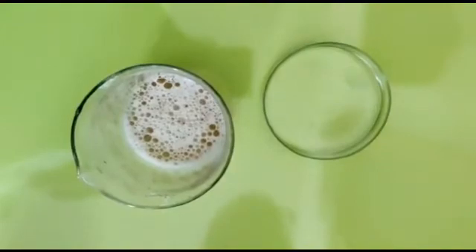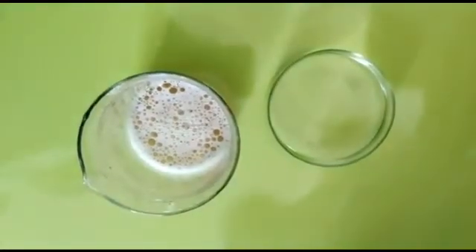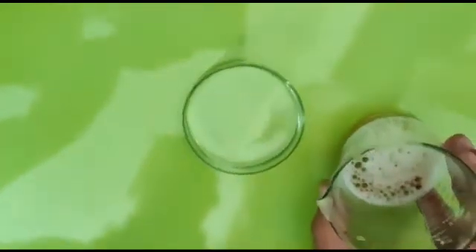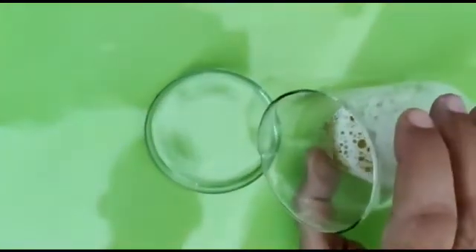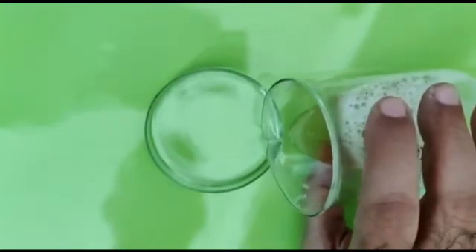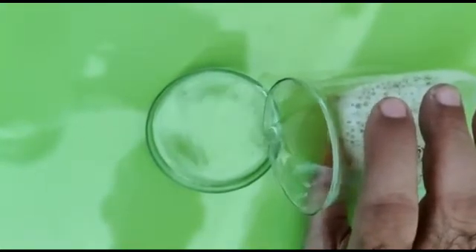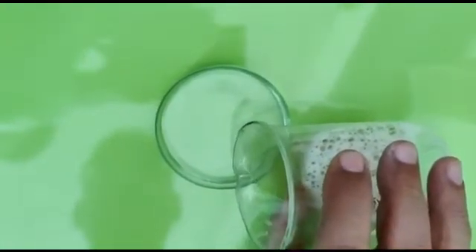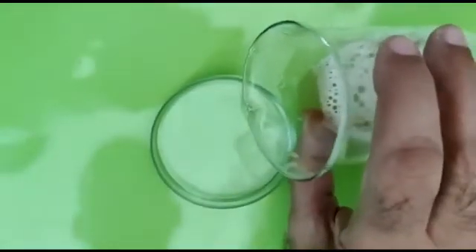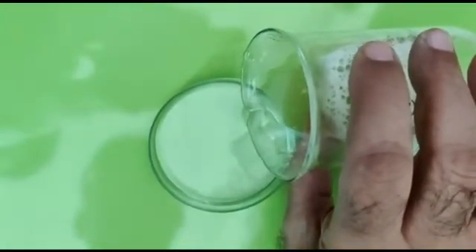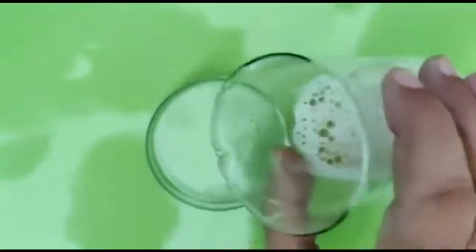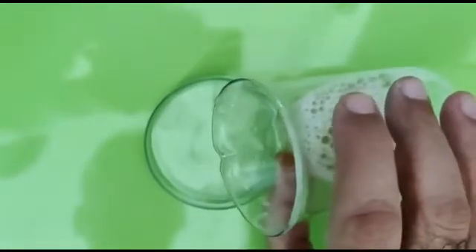In this chilled ethanol, we have to pour the filtrate drop by drop. This is very important—we have to pour drop by drop from one side, in different places of this chilled ethanol.